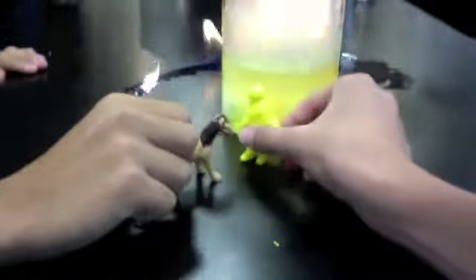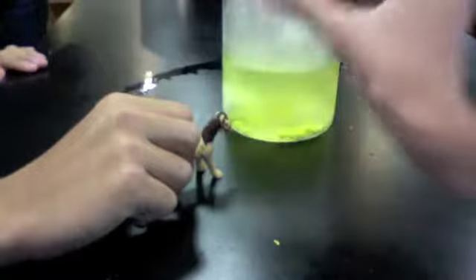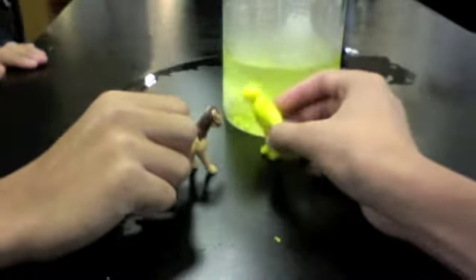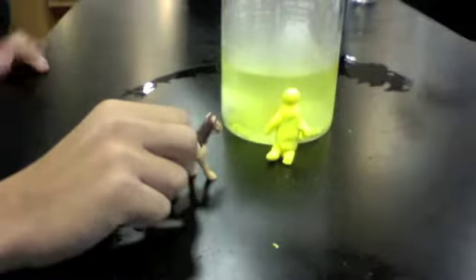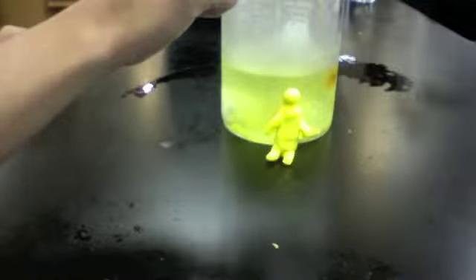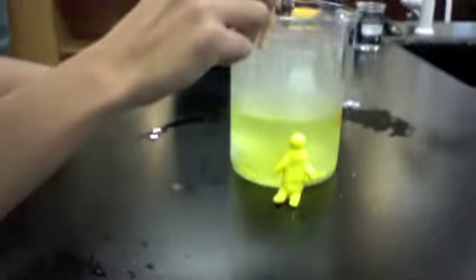You better not go in the dry ice, because the last time I told him, he fell in. You see? Alright. Hey, who are you? I'm the one that got in. I got in. See this? Little nothing. You can do this. No, she told me not to, though. No, it's fine. Look, they're gonna dry ice. Okay. Yeah, you're doing it right. Look in there. This looks cool. Look at his dry ice.